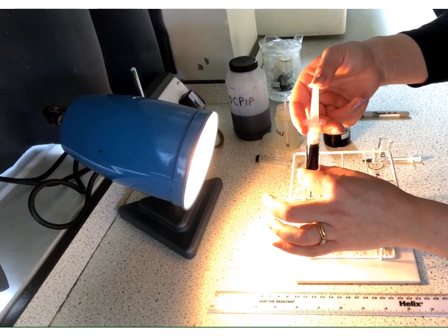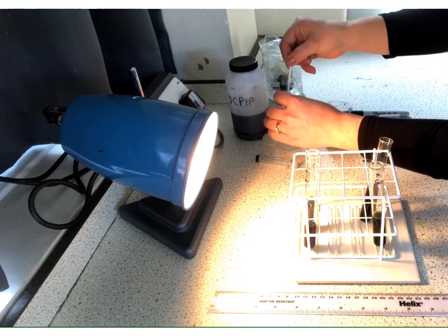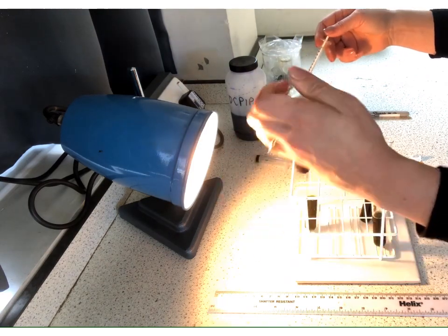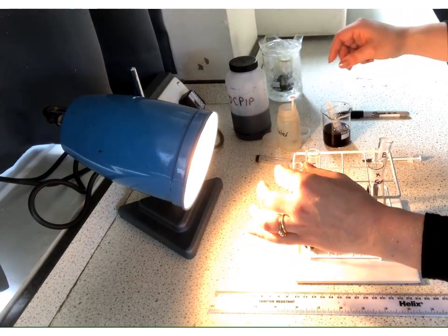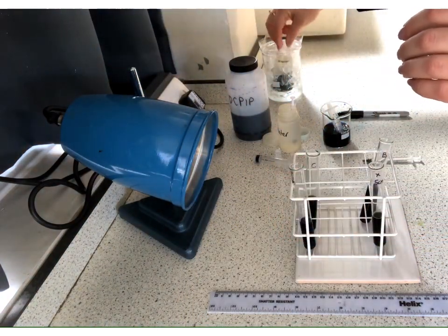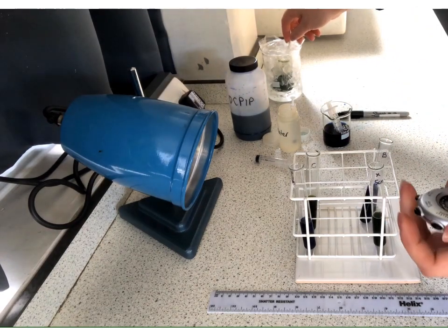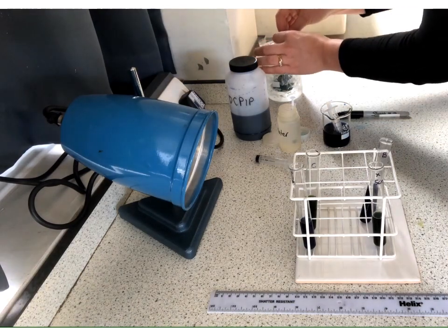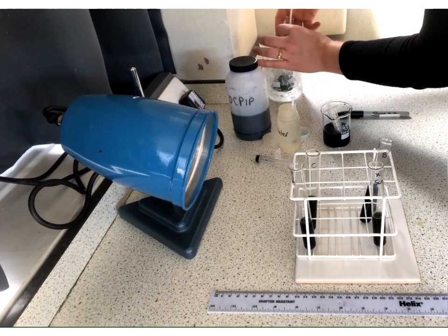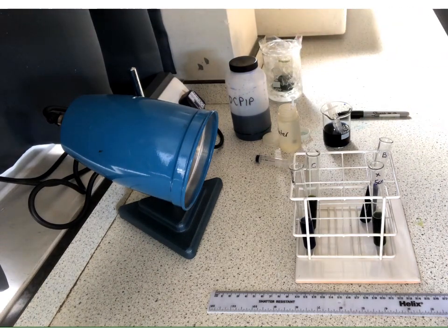I could do with a glamorous assistant for this. I don't have enough hands. Okay, I'm going to mix that. Okay, and then here we go again with the timings. Let's hope I can get this right. I'm going to reset my timer. See how good I can get with this.